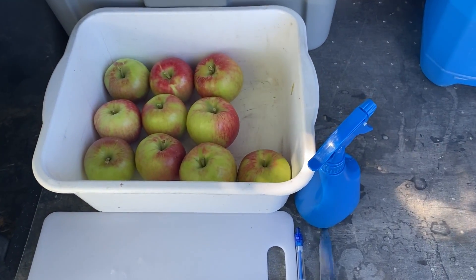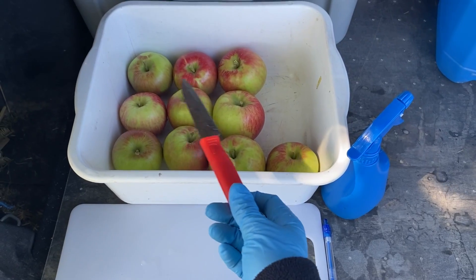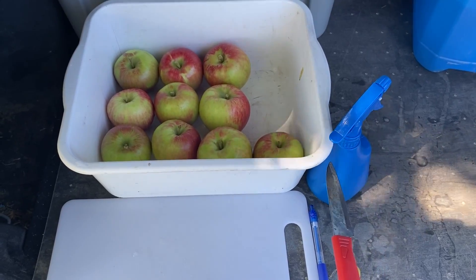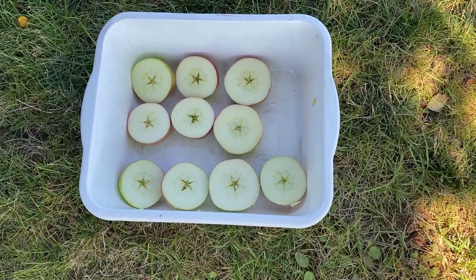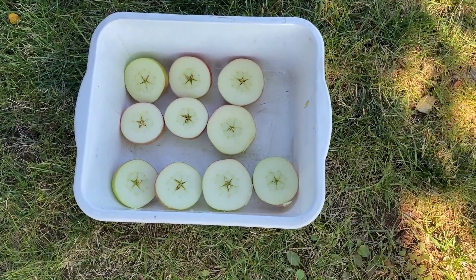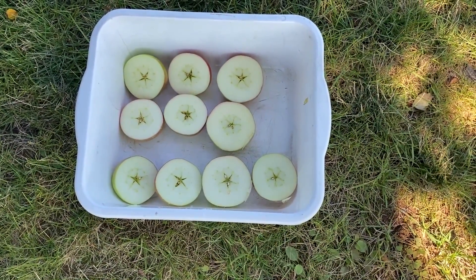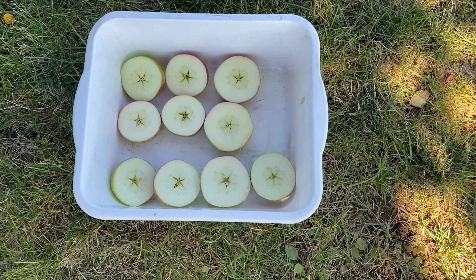Over at my workstation now, I've got the 10 fruit sample and I'm going to cut each of these apples in half and only save half to do the iodine solution test. Here's my fruit cut in half. I like to keep the fruit in a container — it helps to keep it contained, but I also like seeing the white background because it helps to standardize the ratings.